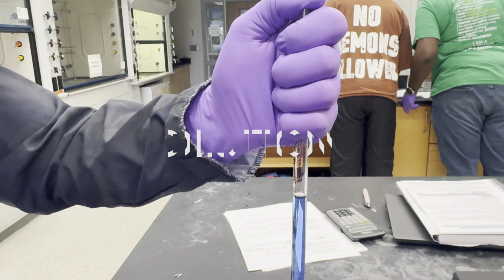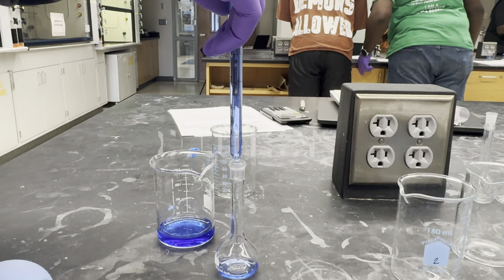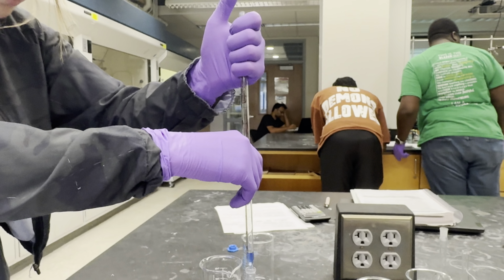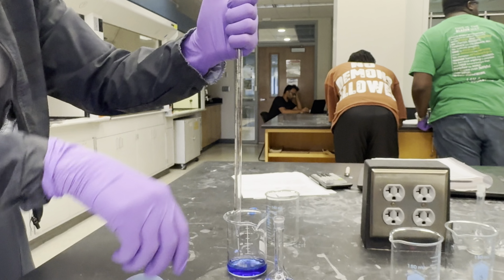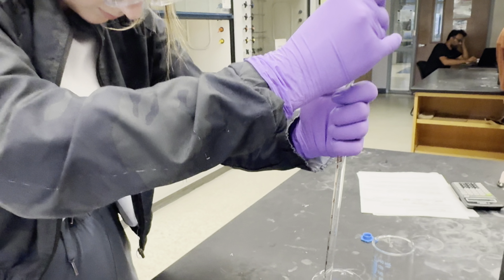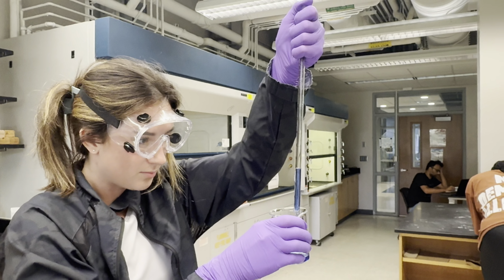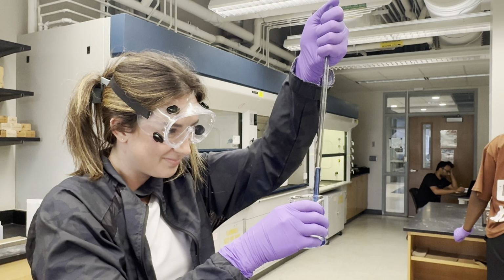A dilution is a less concentrated solution made by adding a solvent to the stock solution. The stock solution and dilutions are related through the dilution equation, which is C1 times V1 equals C2 times V2. C1 is the concentration of the stock solution. V1 is the volume of the stock solution used. C2 is the concentration of the diluted solution. V2 is the total volume of the diluted solution. To derive volume 1 using the experiment, multiply C2 by V2, then divide by C1.